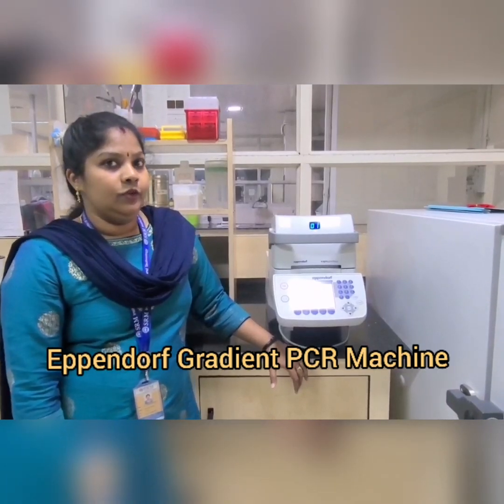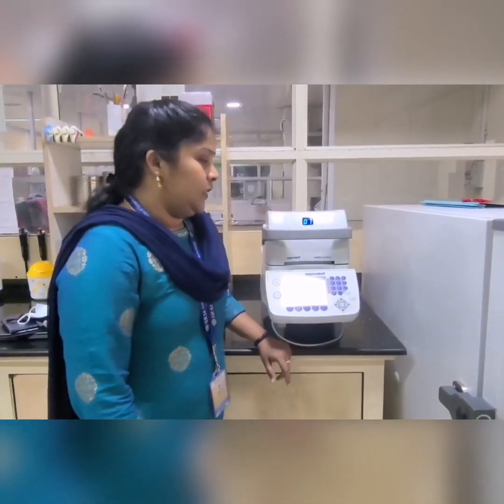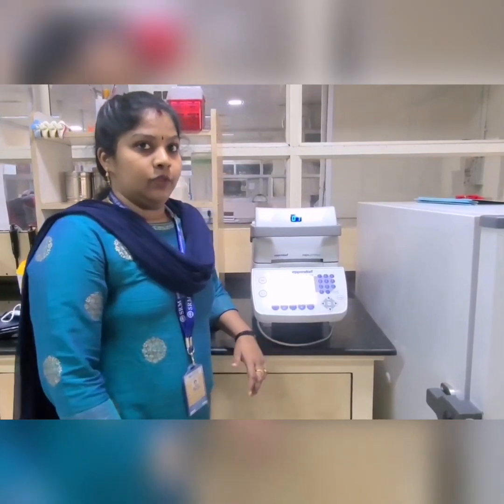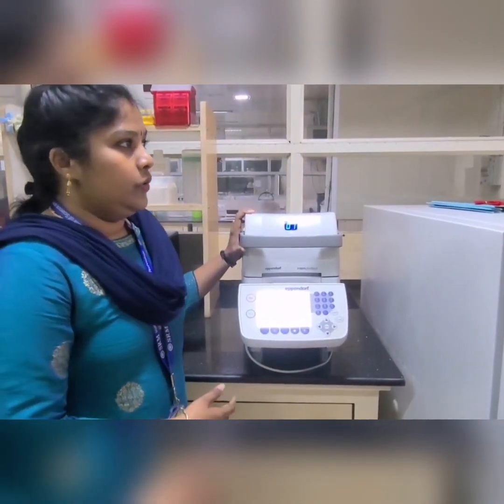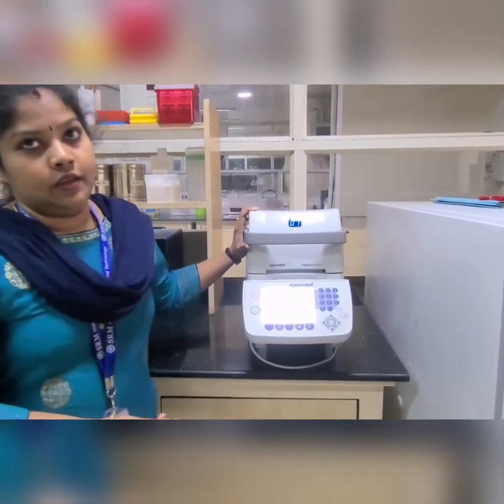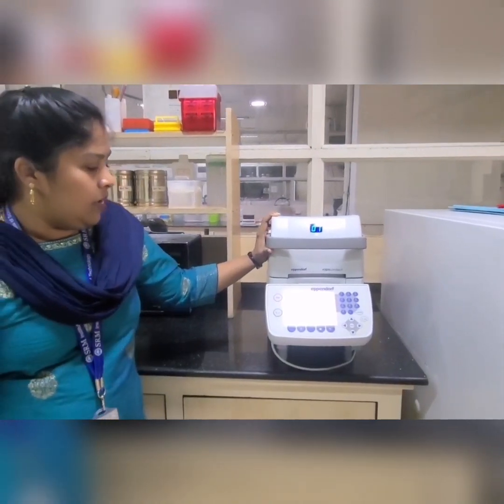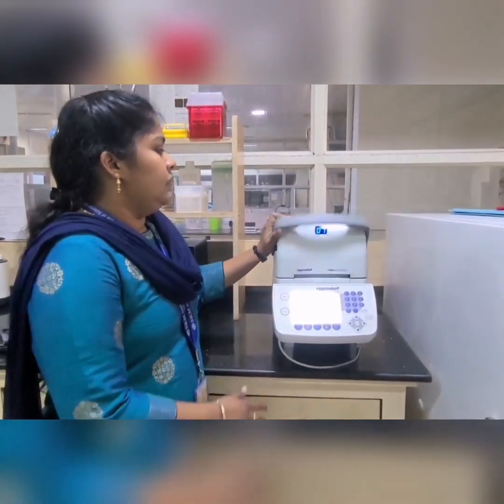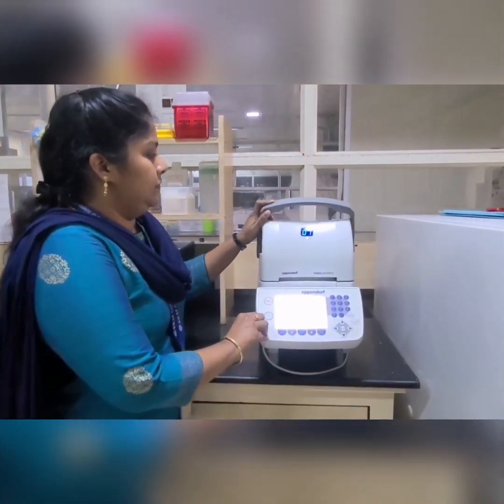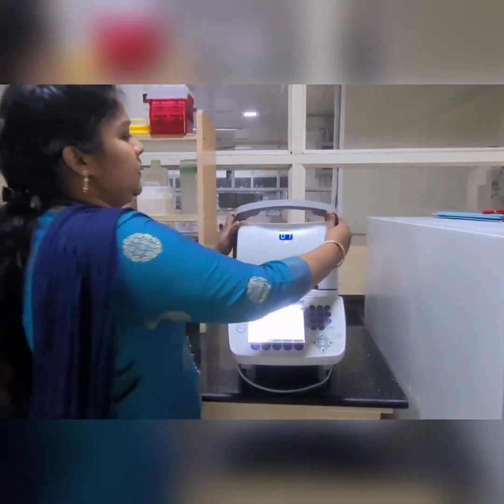Today we are going to see how to set up a reaction in the PCR by using this PCR machine and how you handle it. This is an Eppendorf gradient PCR machine, and here we have 96 wells.